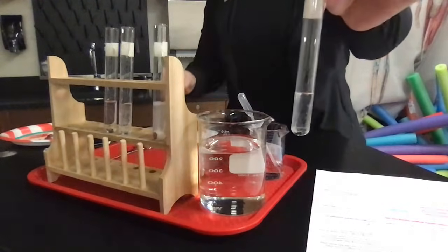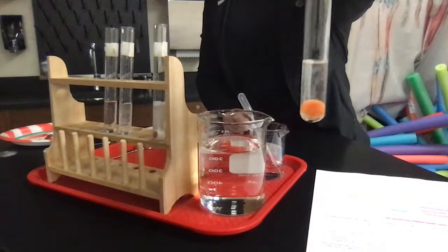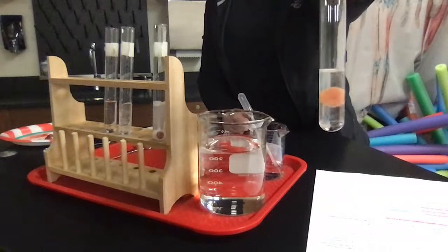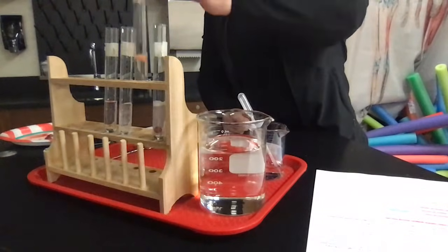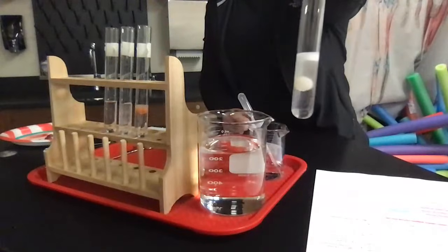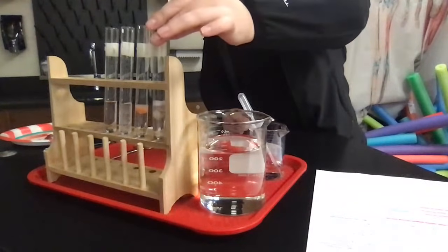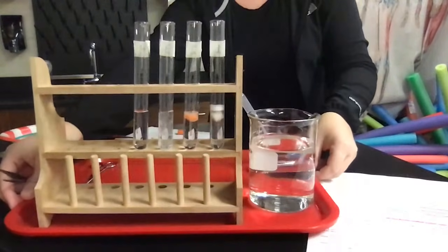That's for the model that my kids are going to be building of this reaction. Test tube 2 here, we're going to put the specimen of carrot. Again, you can see that you have some bubblage happening here. I would not rate this as a very high reaction, but you do have some bubbles forming, which means that you know that the enzyme is working. I would say that the potato is definitely bubbling a little bit more. You can see the bubbles up at the top, which tells you that catalase is more active in a potato than in a carrot. And hopefully you can kind of see that there.